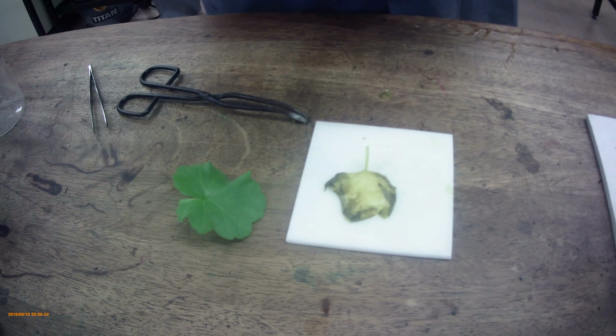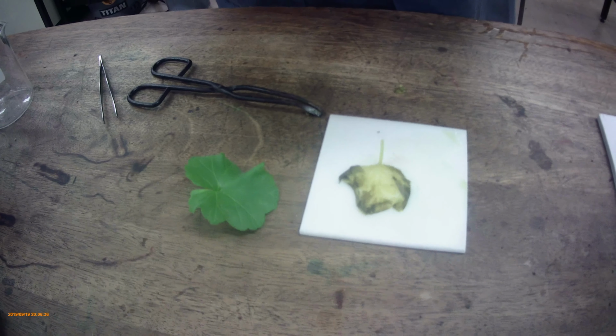Now we're going to take iodine solution again with the dropper. We're just going to put 2 or 3 drops of iodine solution onto the leaf and observe if there is a colour change. Now, at the moment, not a huge amount, but we'll keep going at different parts of the leaf and going round. I'm going to have to soak this one a little bit more. So this one requires a few more drops.